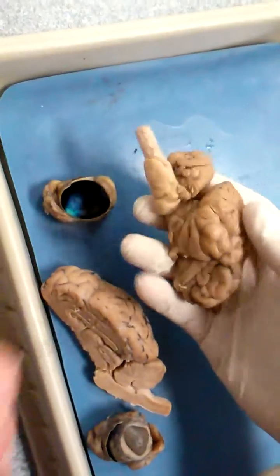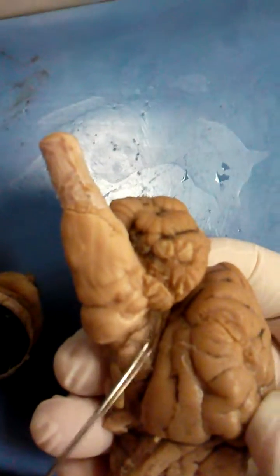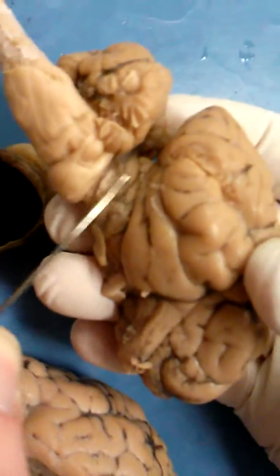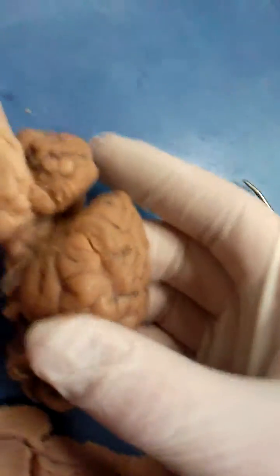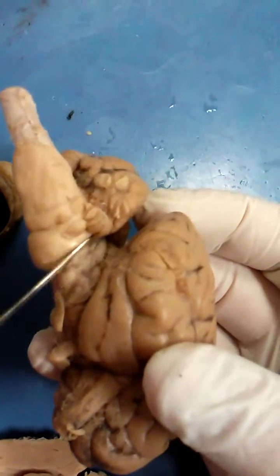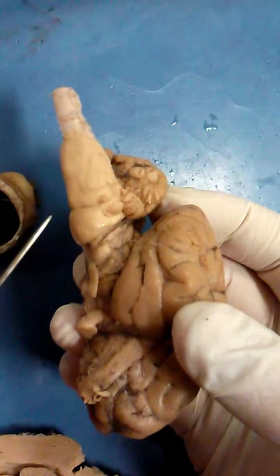These are the cerebral peduncles — a little connecting tract area from the cerebrum to the brainstem. You can kind of see it here, but not really, so just know that it's there. And that is it.